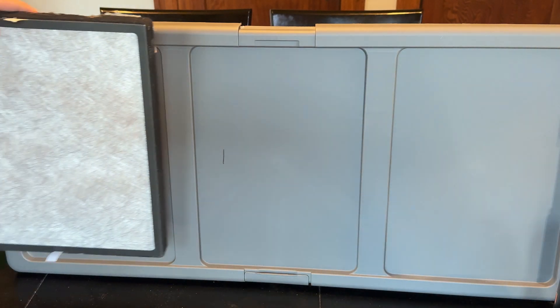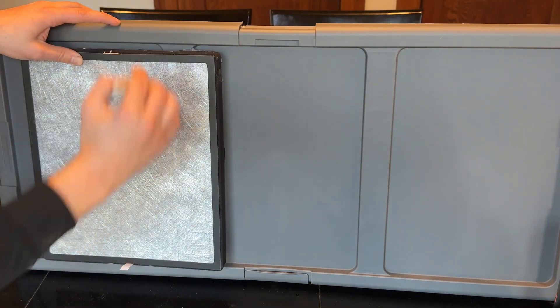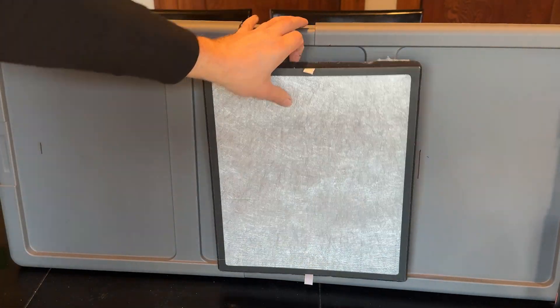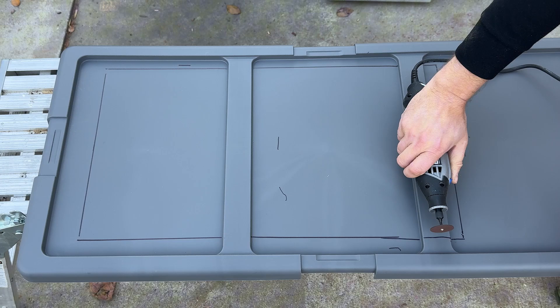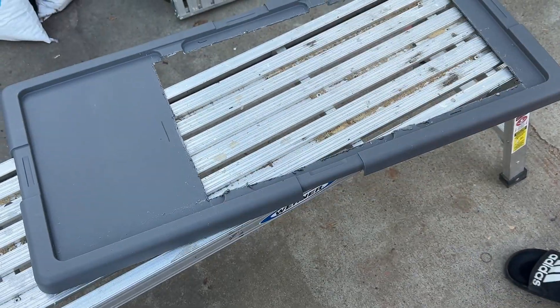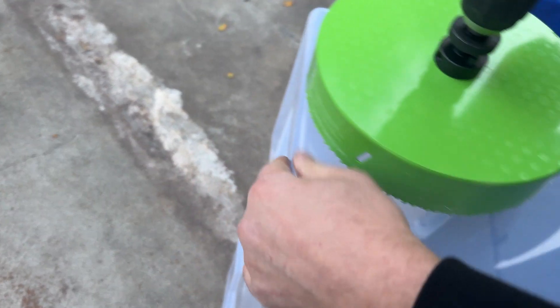We will begin by marking the outlines of the HEPA filter onto the storage bin lid with a Sharpie. Then we're going to take the lid outside and cut out the opening for the HEPA filters — I used a Dremel for this, but you can use a saw too. If the edges are rough like my bin lid here, you can use a utility knife to smooth that out. Now we're going to cut an eight-inch hole into the storage bin.